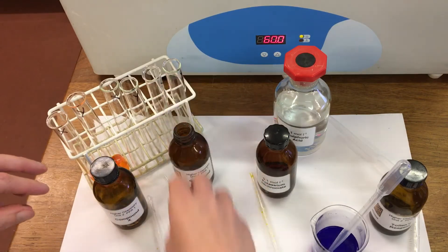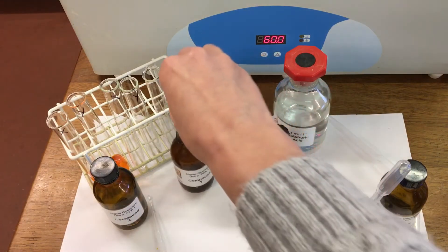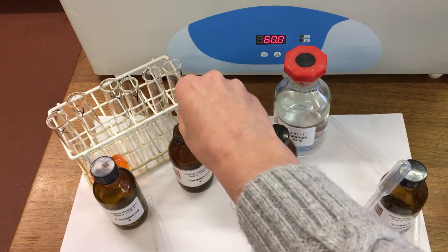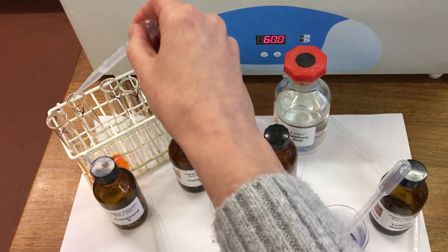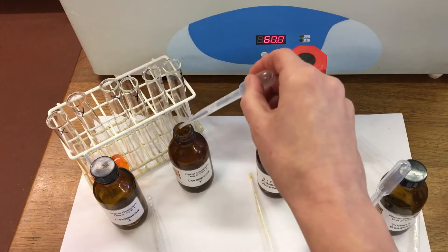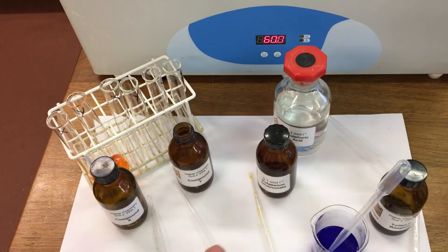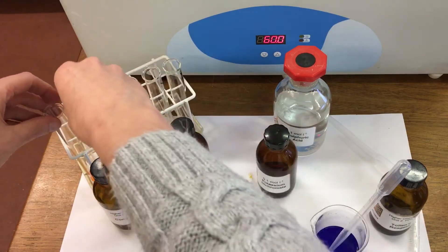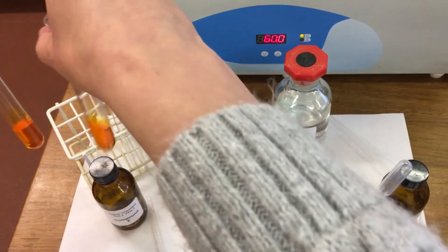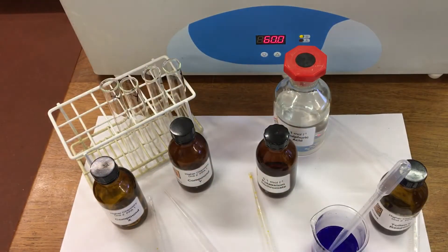I'm then going to put about five drops of each of the compounds into each test tube — compound X and compound Y, five drops into each one. I'll give it a little mix, and then these are going to go into the water bath.